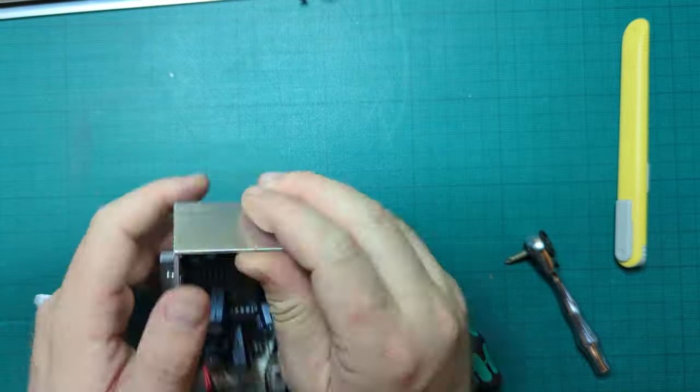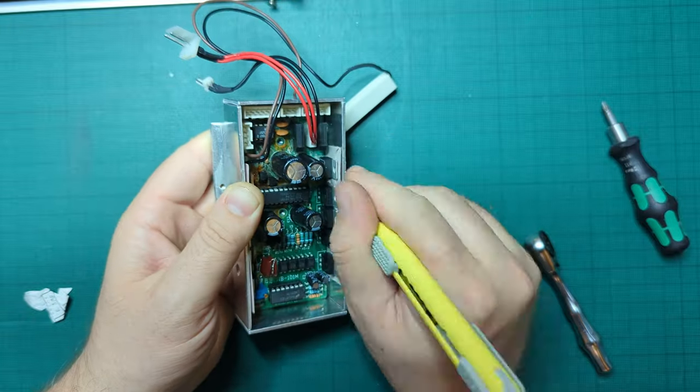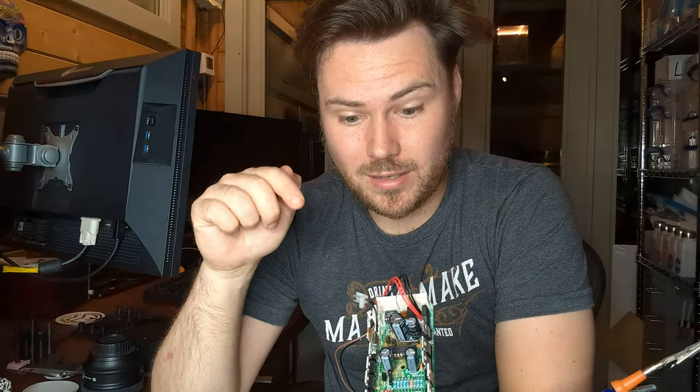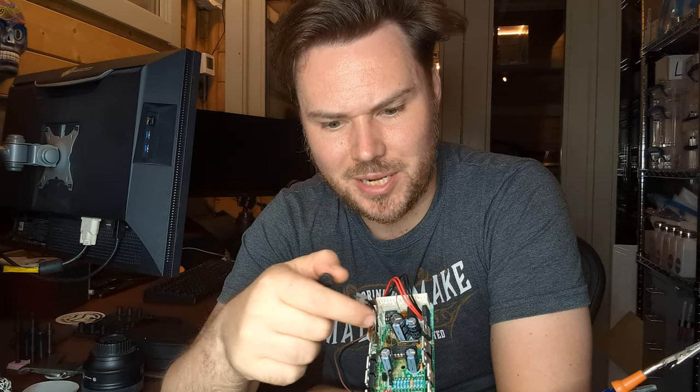It's hard to look around all those components when you've got an aluminium case in the way. Hopefully, it'll be something I can fix. So what have I figured out? Well, clearly there's been some water damage, and I think it's all of this area up here. Now, hopefully, none of the integrated circuits, none of the chips that have any of the clever bits on have been damaged. They look pretty good, but a lot of the components around are damaged.